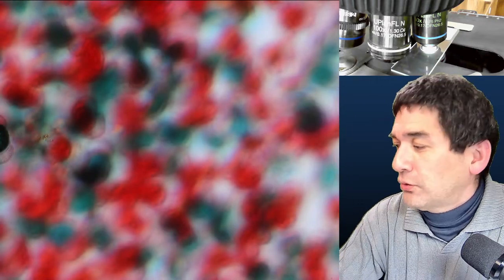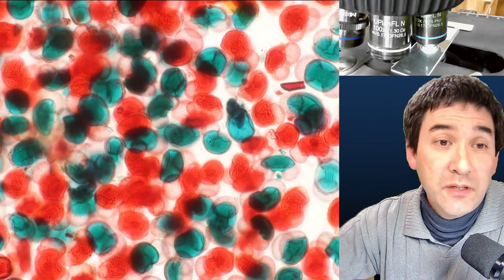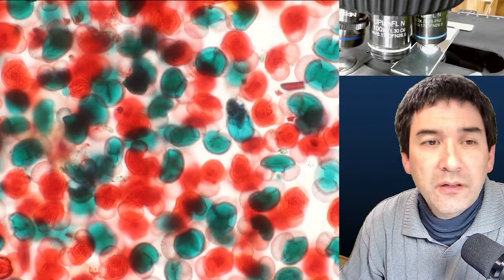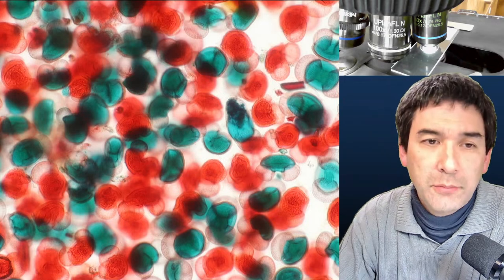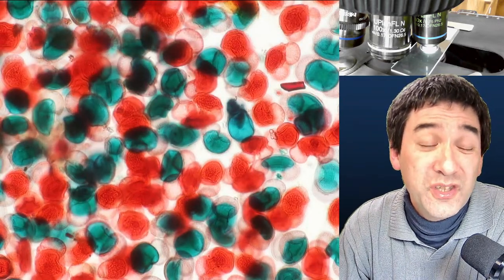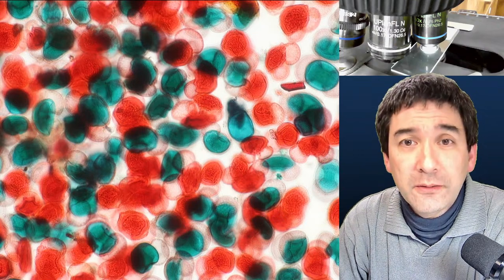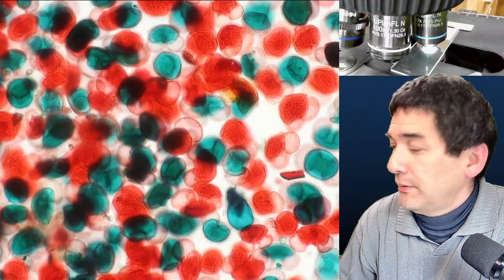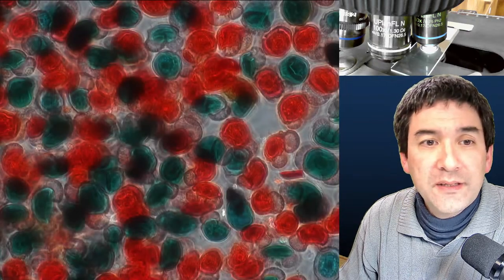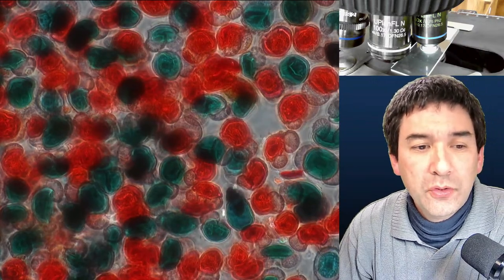Here is how the pollen looks in regular bright field using a phase contrast objective. You can open and close the condenser and see the pollen grains look stained — maybe safranin for the red, possibly methylene blue which can appear green depending on pH. Now let me switch over to phase contrast by inserting the phase contrast condenser setting and opening the condenser.